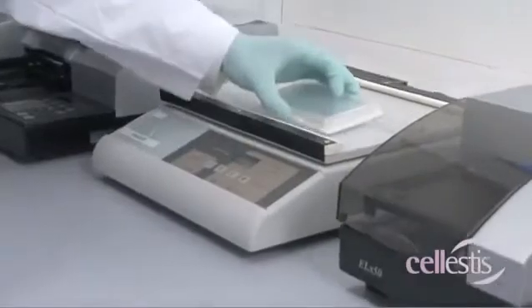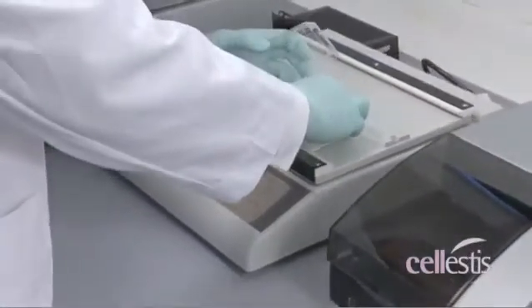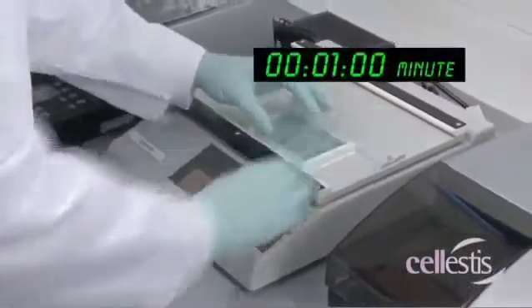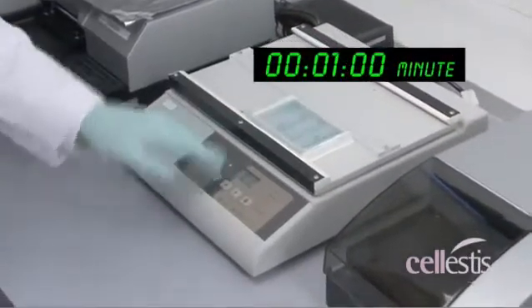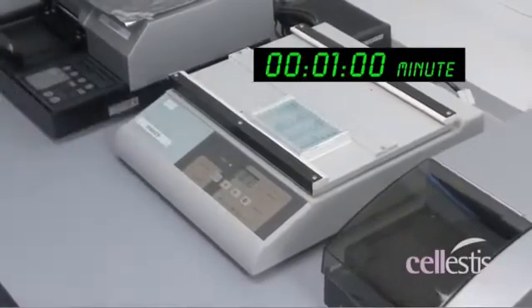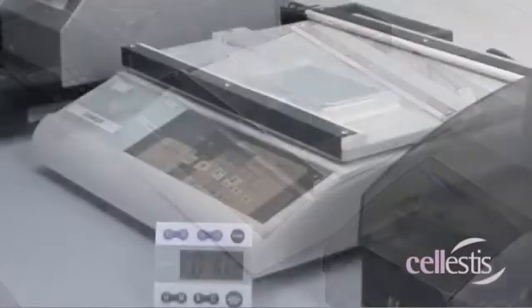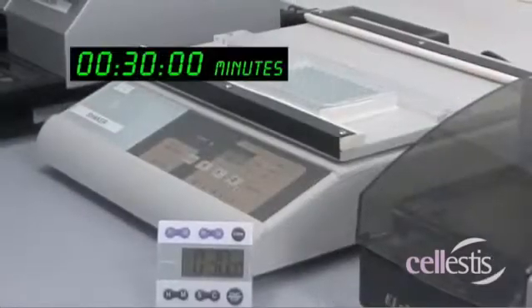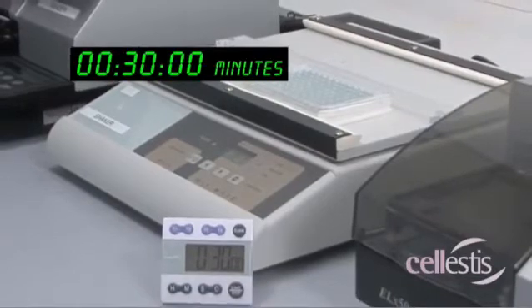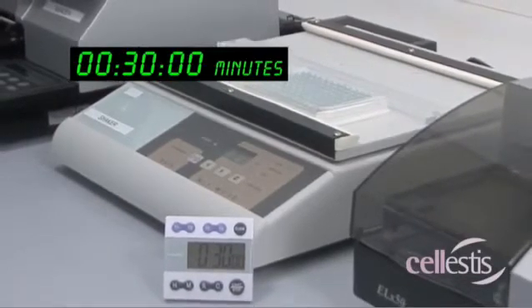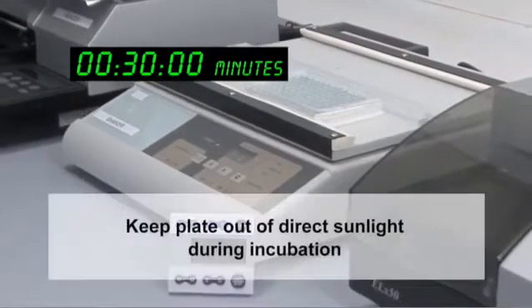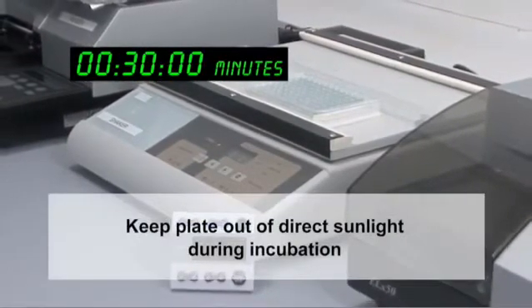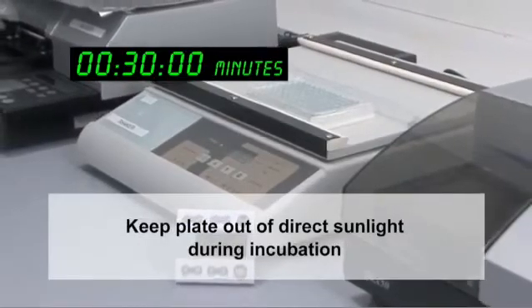Replace the ELISA plate lid and mix the plate thoroughly on a microplate shaker for one minute, ensuring the samples do not spill. Incubate the plate at room temperature for 30 minutes. The plate should not be exposed to direct sunlight during this incubation.